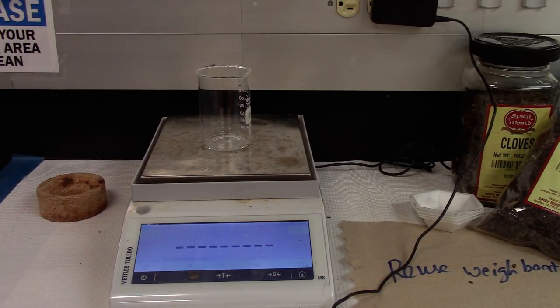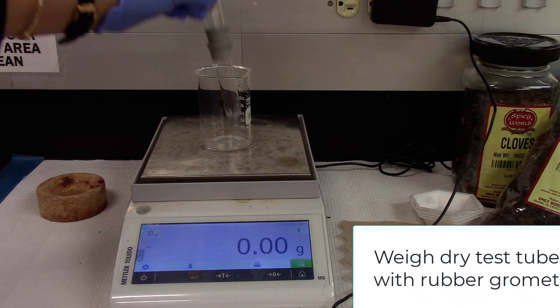Tare a beaker and weigh the empty dry test tube with rubber grommets.